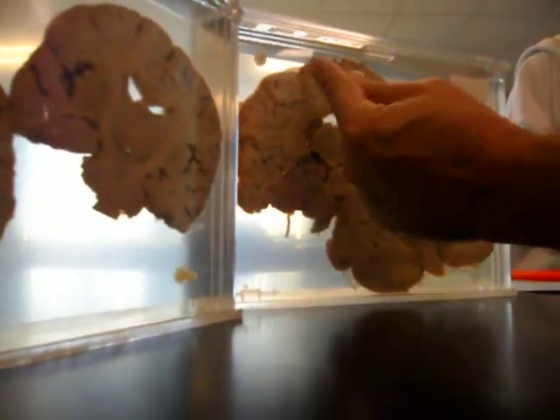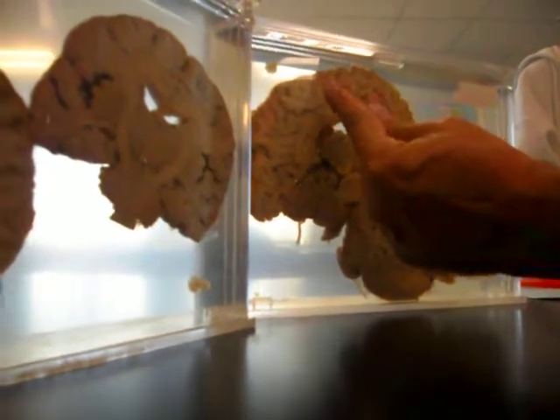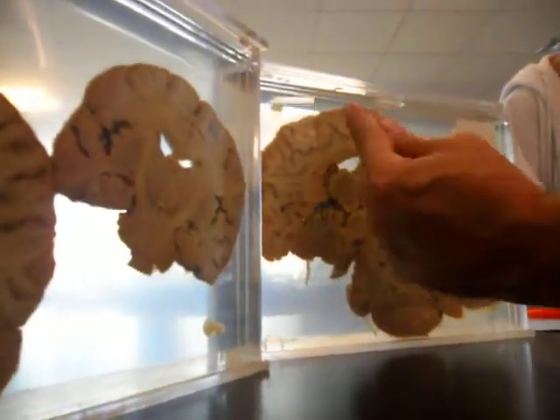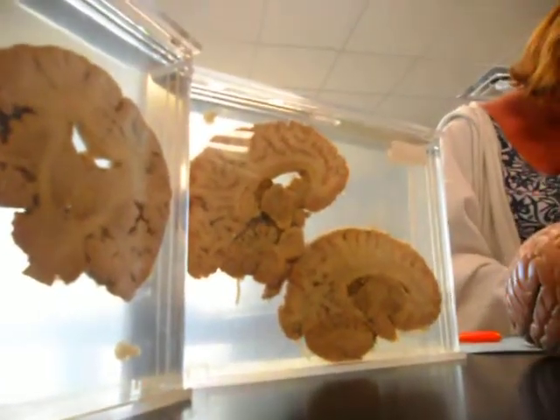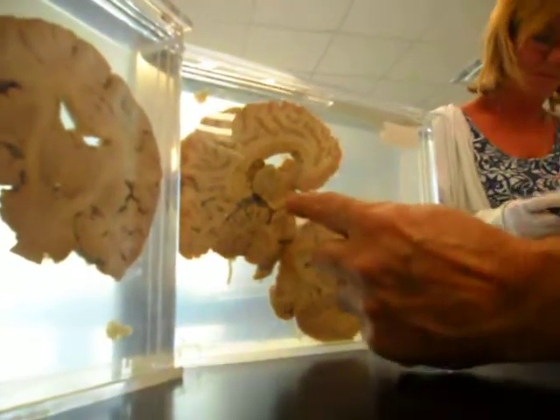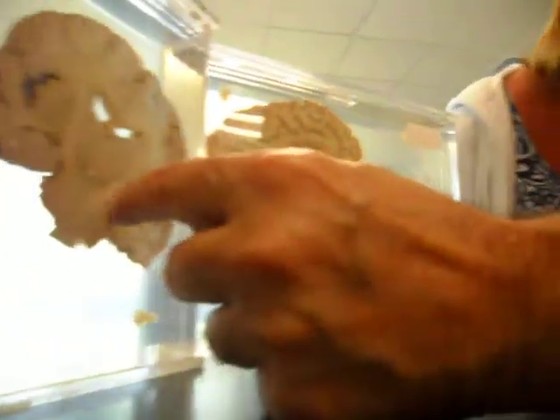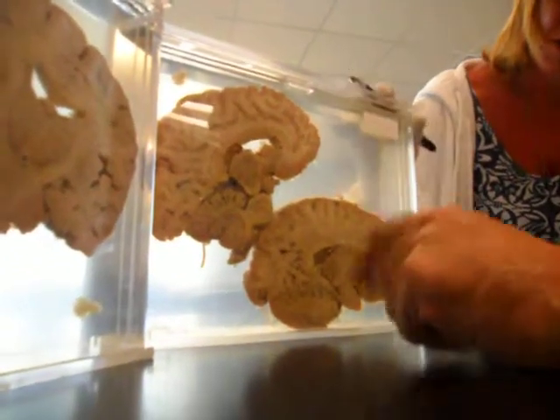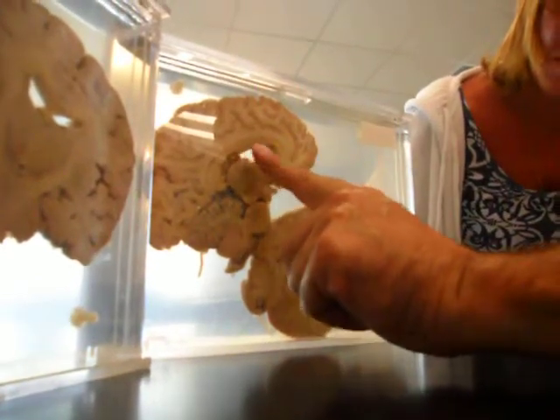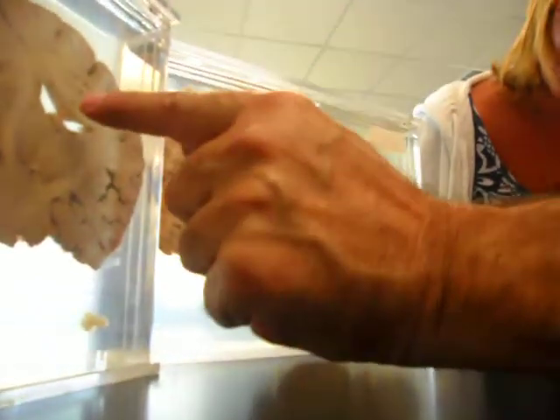That's parietal. You see this line? This line is separating the frontal lobe from the parietal lobe. Who is it? Central sulcus. Very good. Okay, this round structure here is the same as this round structure here. Pons. That's the pons. Here's another piece of that thin skin separating the two ventricles.